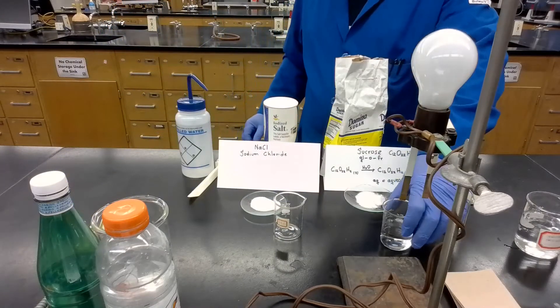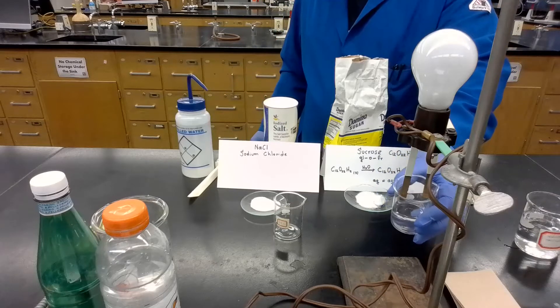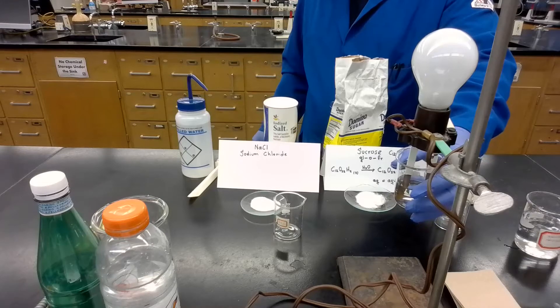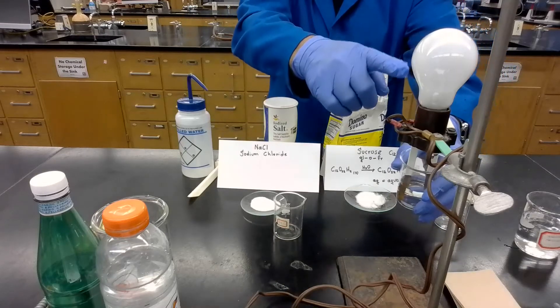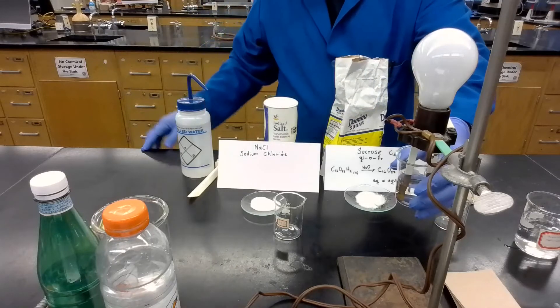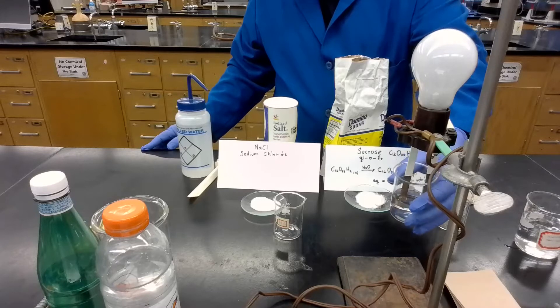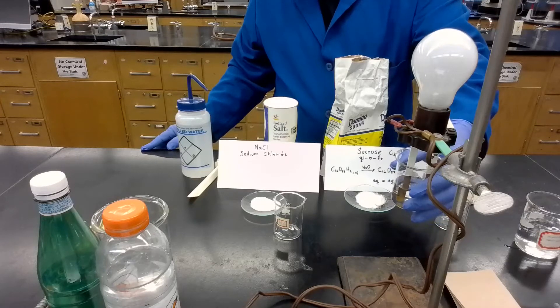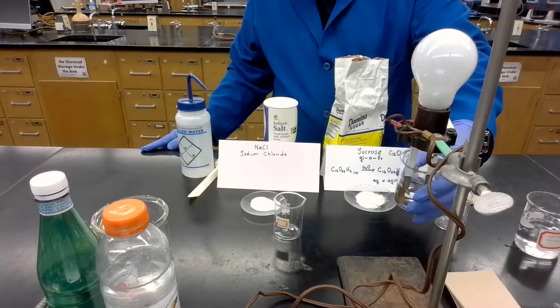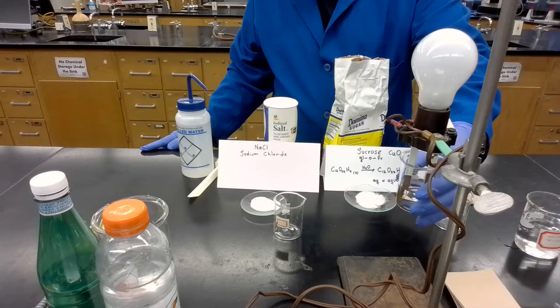Let's test the distilled water. Let's see what happens — if it can close the circuit. We see nothing coming up here. No light. So we can say that there is nothing in the distilled water that facilitates the flow of electrons from one terminal to the other.